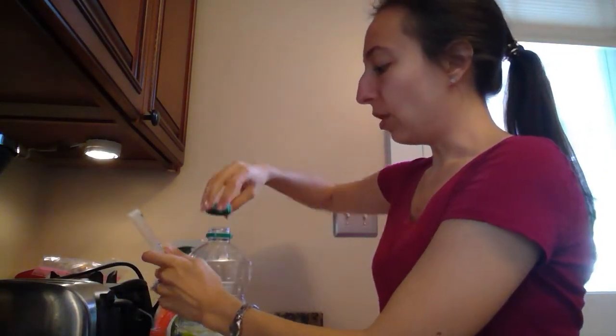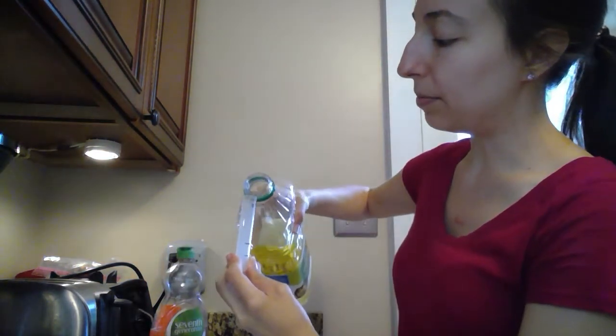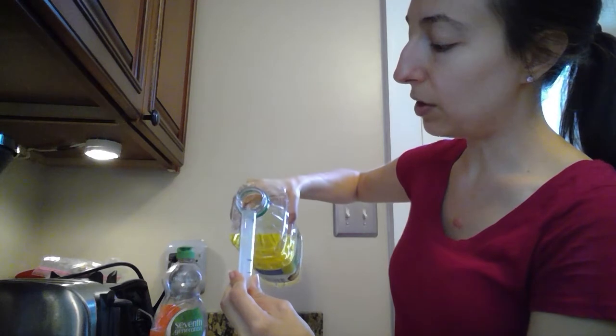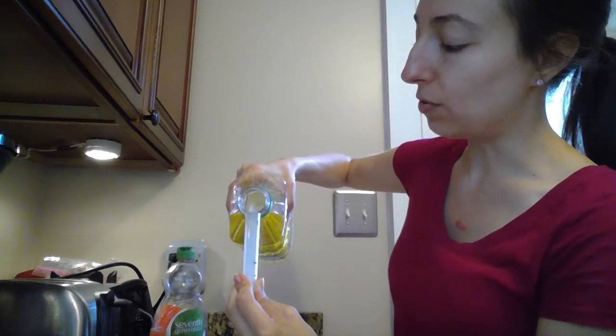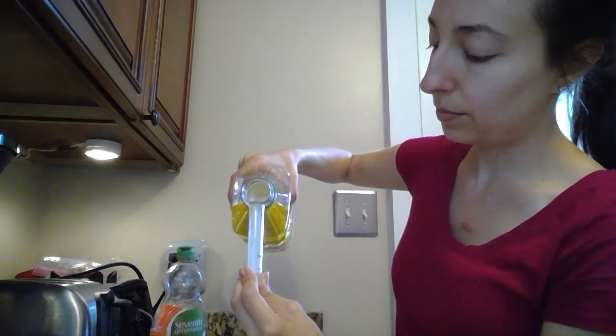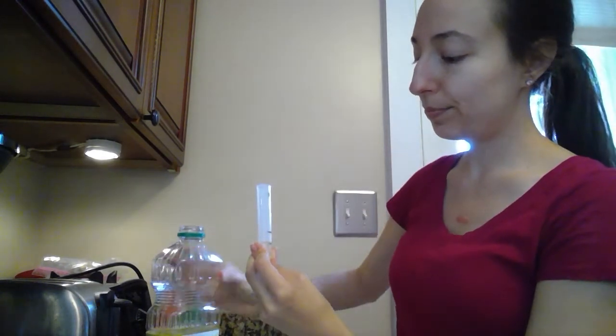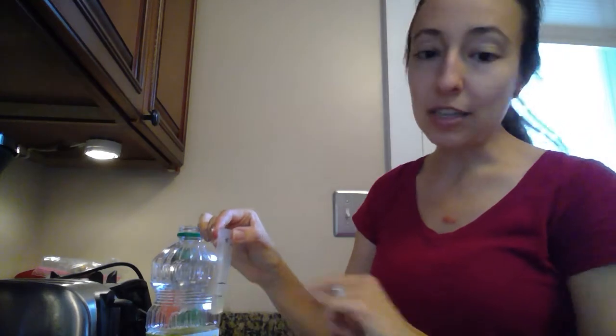I'm going to use canola oil for this first part. So test tube number 1, I'm going to put oil in just to that very first line. And you can use a pipette for this, or maybe you just go very slowly. Okay, a little above, but there we go. And then we're going to fill it up to that next line with water. And we're going to do the same thing for both of these test tubes.